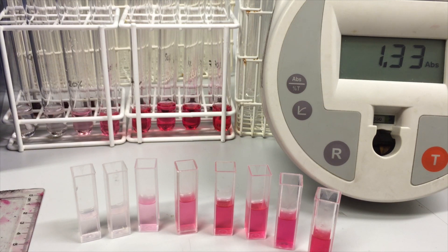Things that we could do to control, to make it so that the dye is only affected by the alcohol concentration, those things are what makes our experiment valid. Okay, hope you found this useful and good luck.